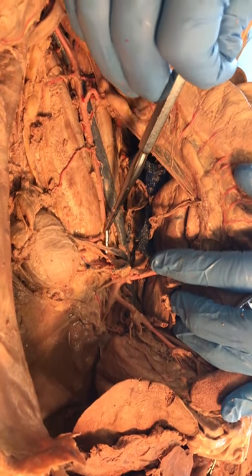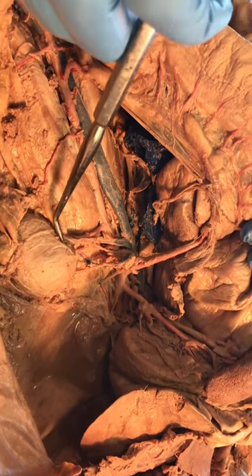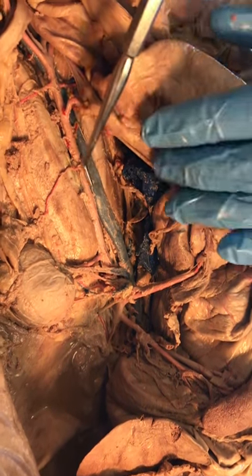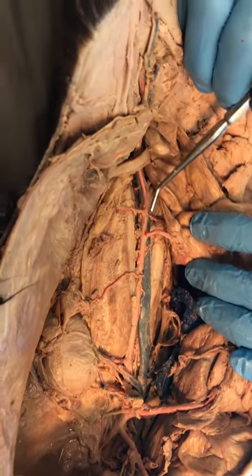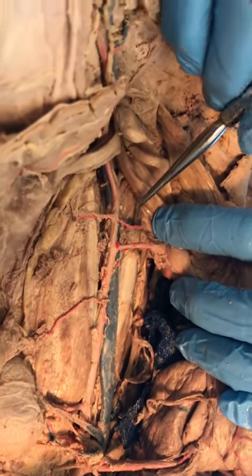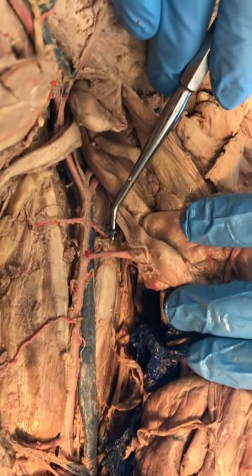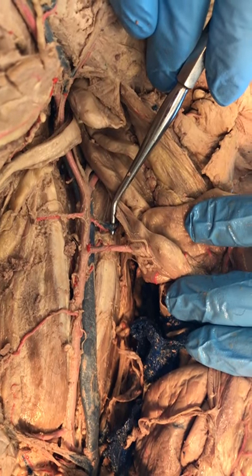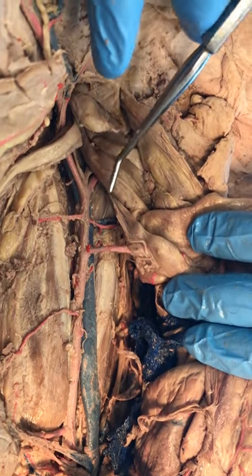The next vein you can see is entering the hilum of the kidney, so this is the renal vein going to the hilum of the kidney. The post cava continues down to the ilio lumbar. The ilio lumbar vein is missing on this side, so let's look at the right ilio lumbar vein — there it is. The iliac crest goes around the hip of the cat, and we've just named the vein to reflect that bone structure.